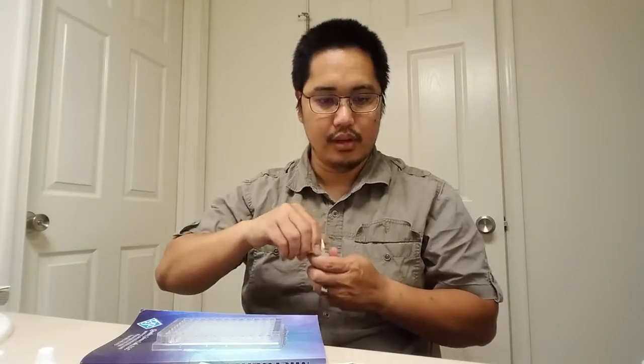So what we have is 0.1 moles, and then we divided that by 5, so now we have 0.02 moles, and we divided that by 5, and so we have now 0.004 moles, and so on and so on. Now I'm going to put 1 drop of the sodium oxalate inside of wells A1 through A7.